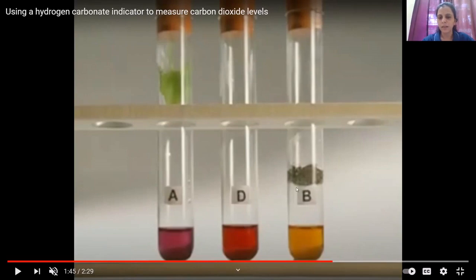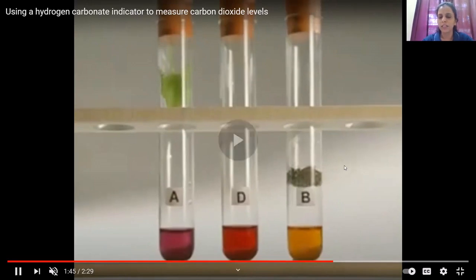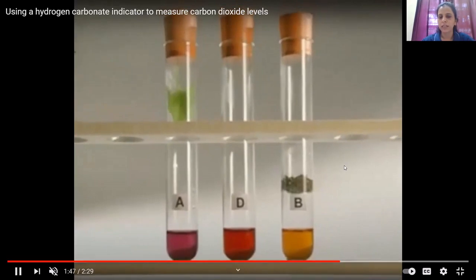In test tube B, wood lice were present. So these wood lice have actually performed respiration and carbon dioxide gas was released in the air. As the concentration of CO2 increased in the air, the color of hydrogen carbonate indicator changed to yellow.